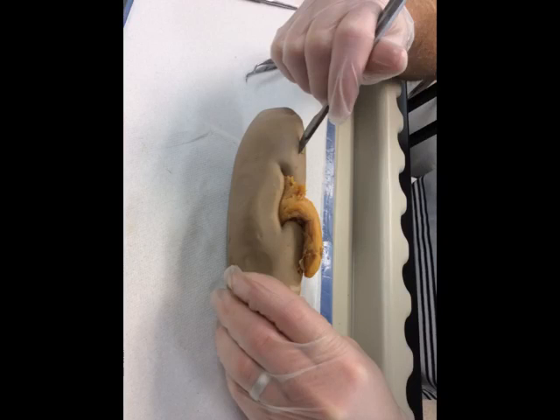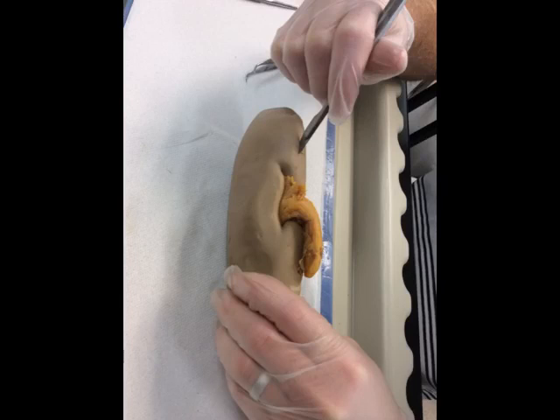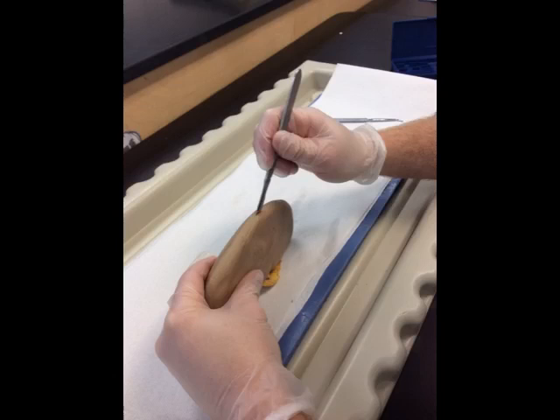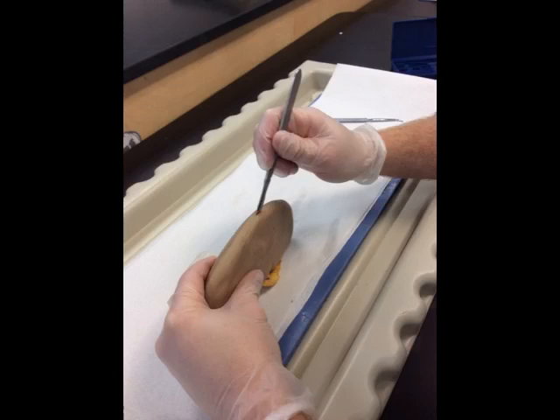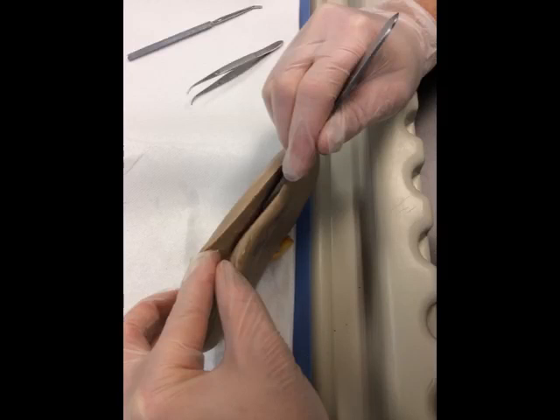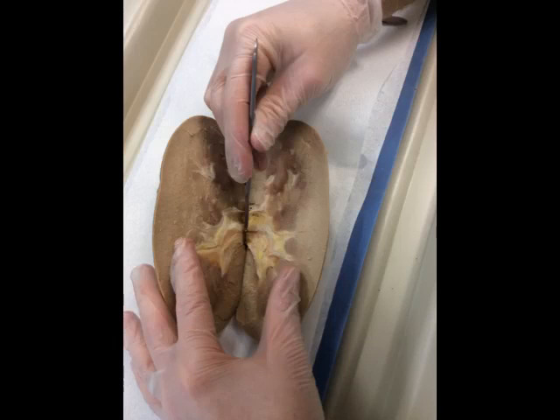Before you can begin your observations of the internal structures of your kidney, you're going to take your scalpel and make an incision as deep as you can, beginning at one end of the hilum. Continue your incision all the way around the kidney to the other end of the hilum. Then carefully pry apart your kidney and make incisions using long strokes, continuing all the way through the renal pelvis.